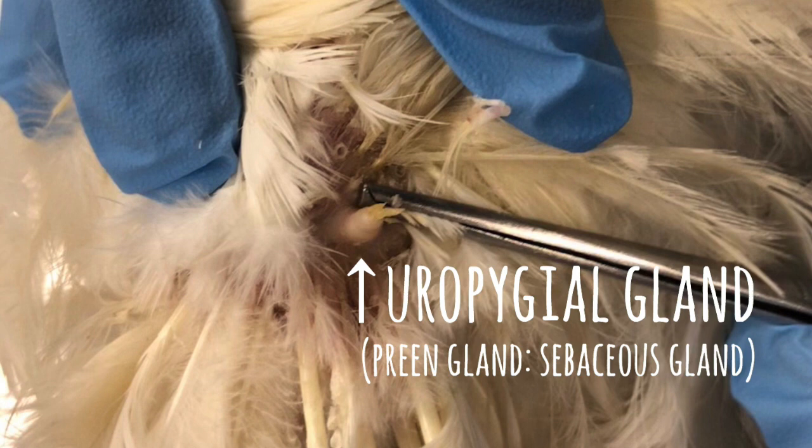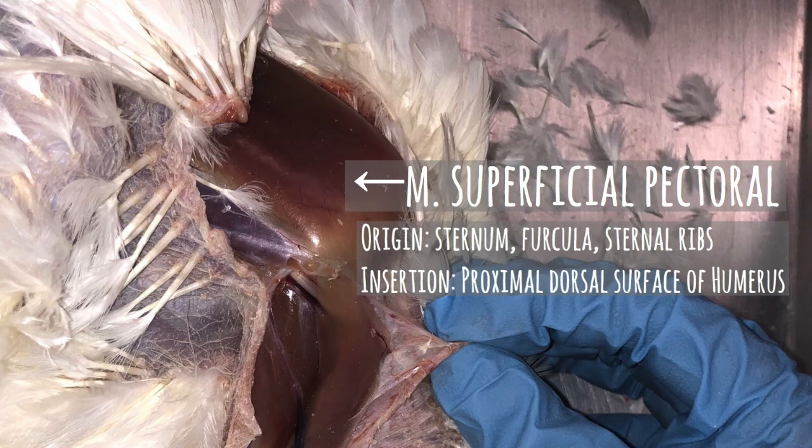The uropygial gland, aka the preen gland, is a large bilobed sebaceous gland at the base of the tail. It secretes oil for the chicken to distribute. As for the muscular system, in the breast and wing of the chicken, we have the M superficial pectoral, which is the largest muscle in birds and moves the wing downwards.